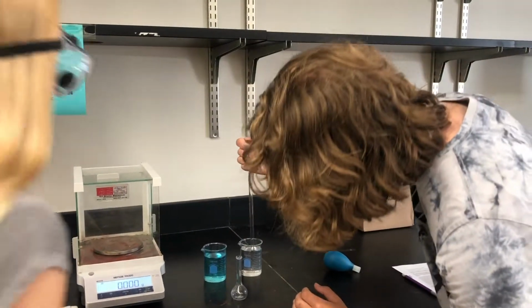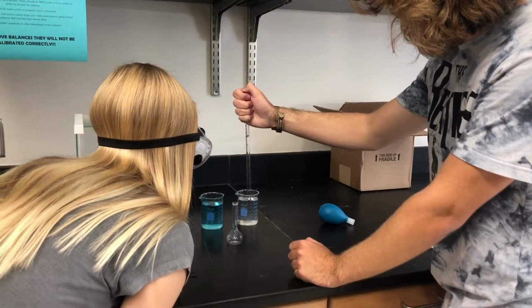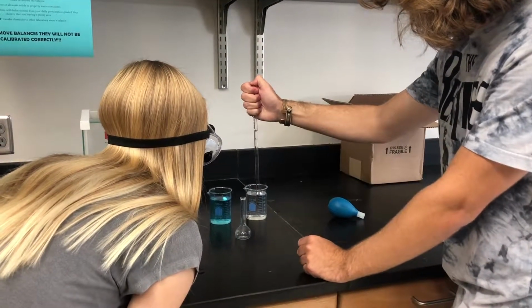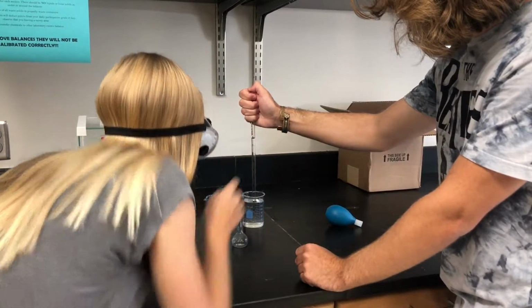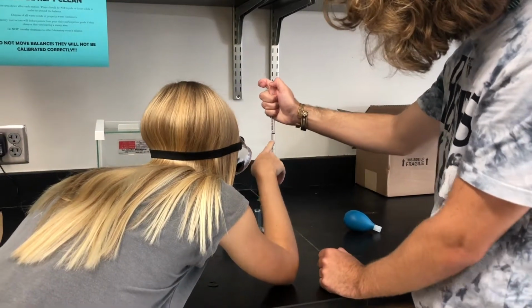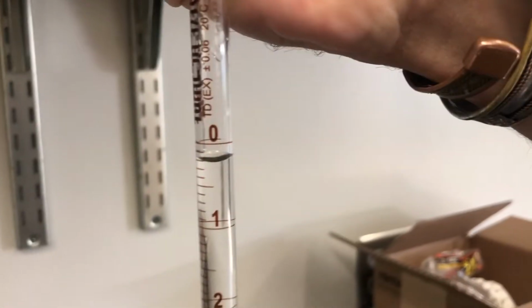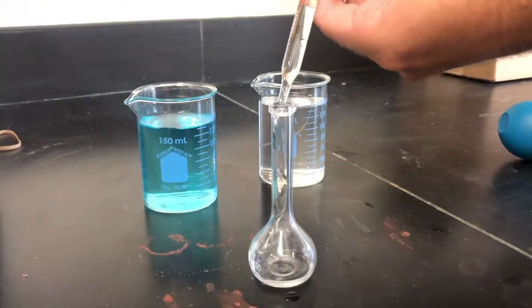In this lab, the 20% stock solution of sugar is getting diluted by the solvent, which is water. Here you can see we are drawing the stock solution up a 10 milliliter graduated pipette and reading the volume at the meniscus. The meniscus is the lowest part of the curve created by water's surface tension in its container. Then we are placing it into the 25 milliliter volumetric flask.